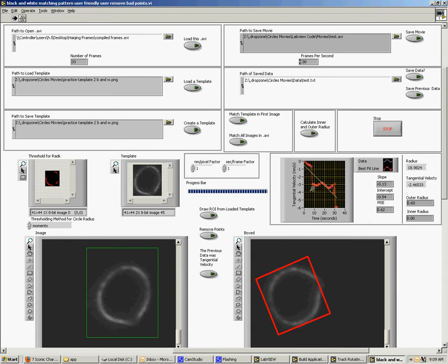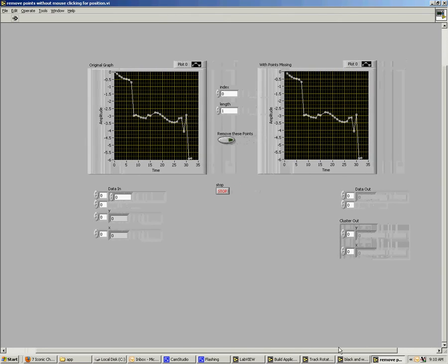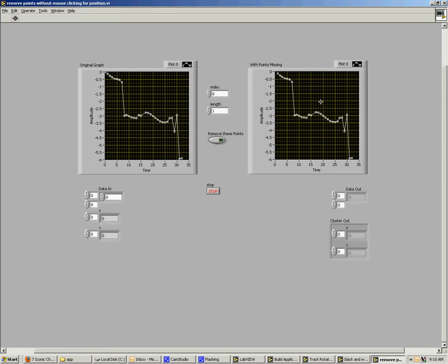Okay, now as you can see, this is pretty poor, very bad data. However, there is a line here that is correct. You have to take it out from this poor data around it. Now to do that, I have this option to remove points. You click that button, and a new window opens up. This is the original data, and it's going to be the data you play around with.